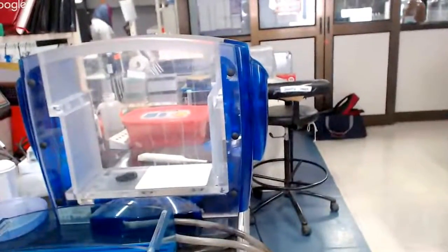For the second dimension we have a large setup — these are much bigger glass plates — and we have a running unit which can take six large gels simultaneously. We will show you how to run the gel in these large units for the second dimension. Once the run has finished, you have to add staining solution — we cannot show that right now because you have to wait a long time for the gel to stain.